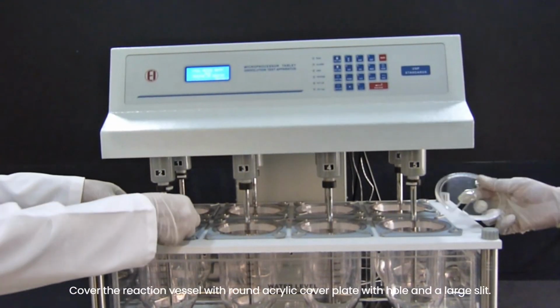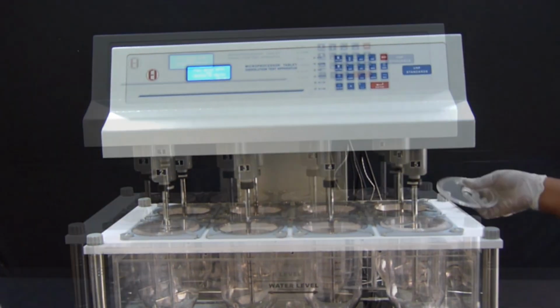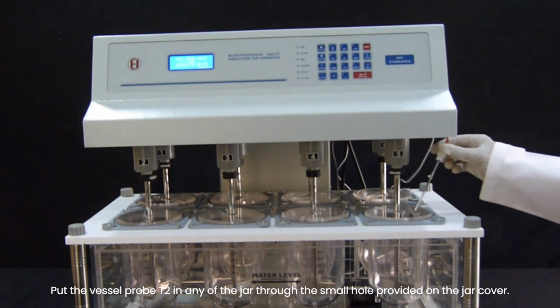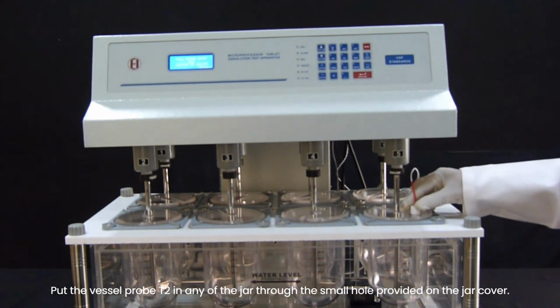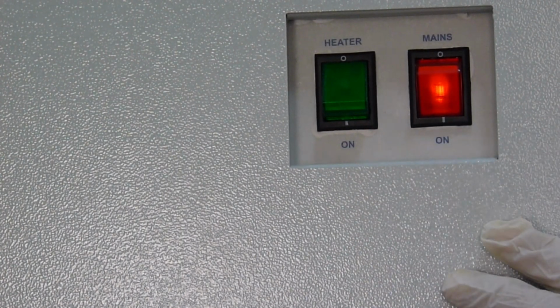Cover the reaction vessel with round acrylic cover plate with hole and a large slit. Put the vessel probe T2 in any of the jars through the small hole provided on the jar cover. Switch on the instrument and the heater.